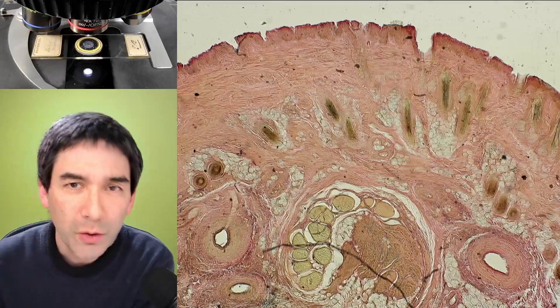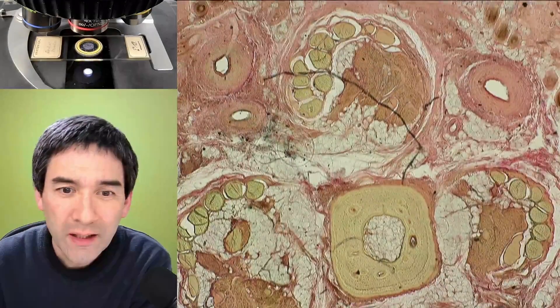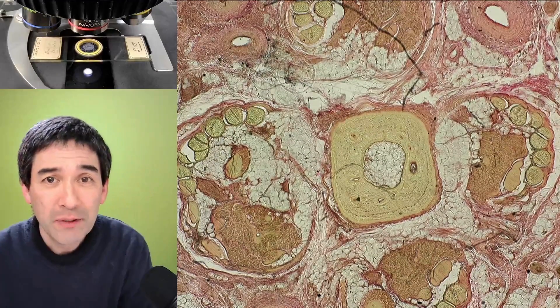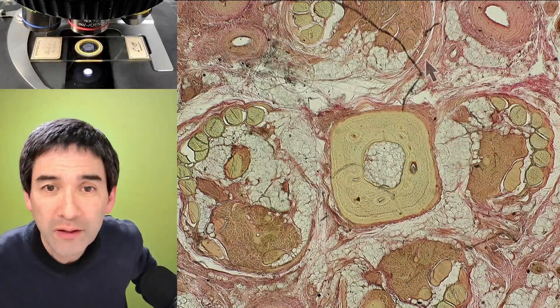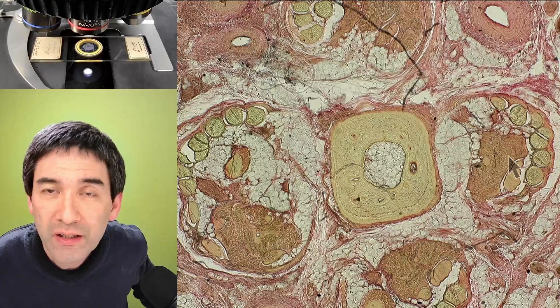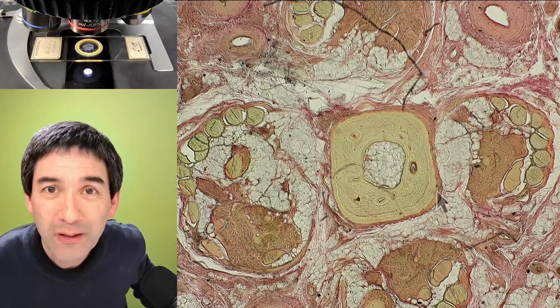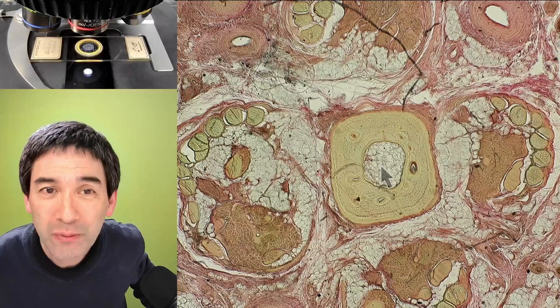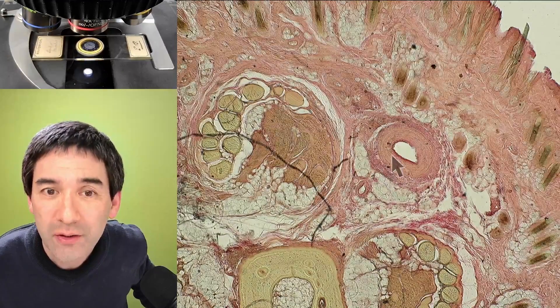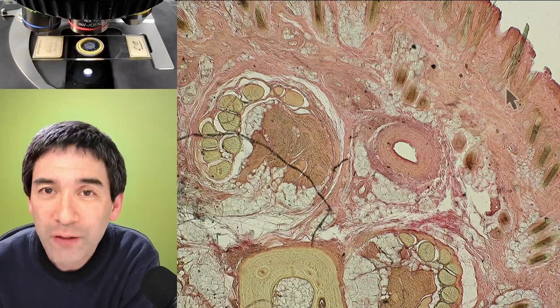I'm now going to show you the tail of a monkey as well — there's a little bit more to see. We're starting off at a low magnification. What I really like here is that we're able to see all sorts of different tissue types. In the center, you see the bone of the tail, with the bone marrow in the center, and of course muscles left and right, at the top and bottom as well — so the tail of the monkey can be moved in all possible directions. We're also able to see some blood vessels — that here is an artery, for example. And those things on the side are the hair follicles for the fur.